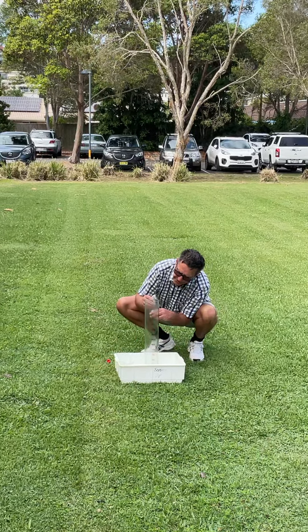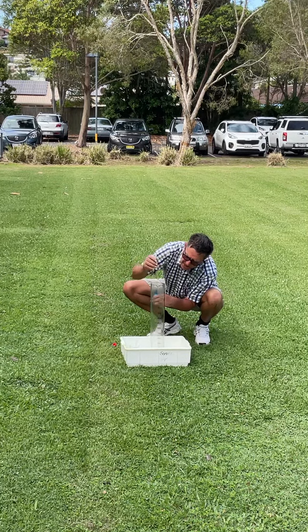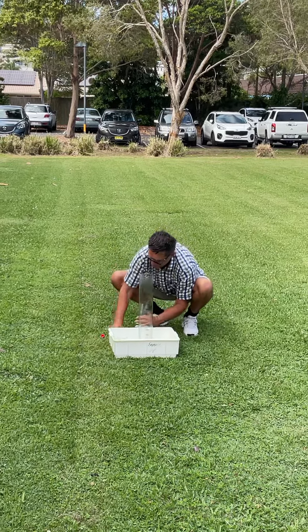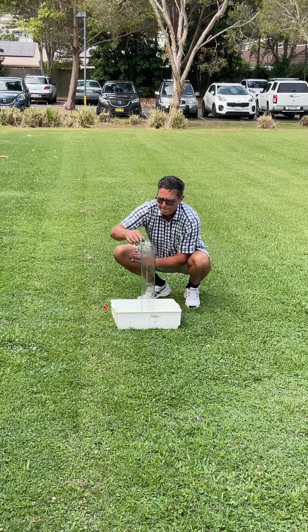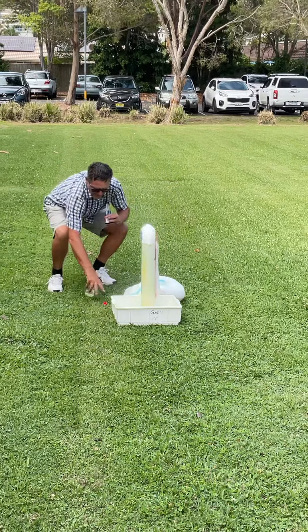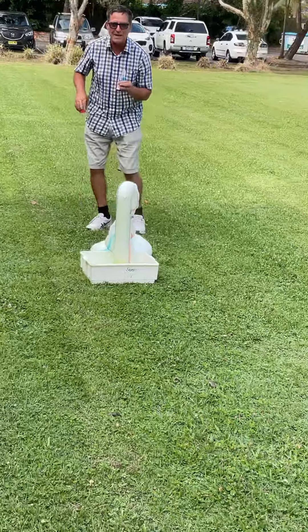A little bit more with the blue to get it to go down the bottom — the blue's going down that side. Now we get this out of the way, add a catalyst, and see what happens. You can come in and look at it a bit closer.